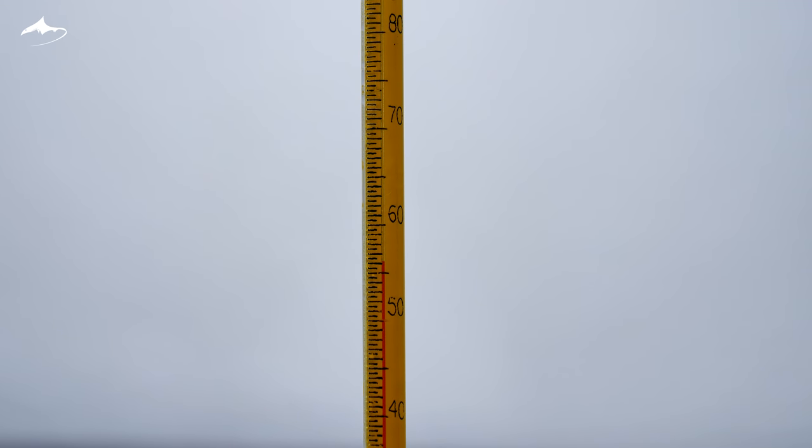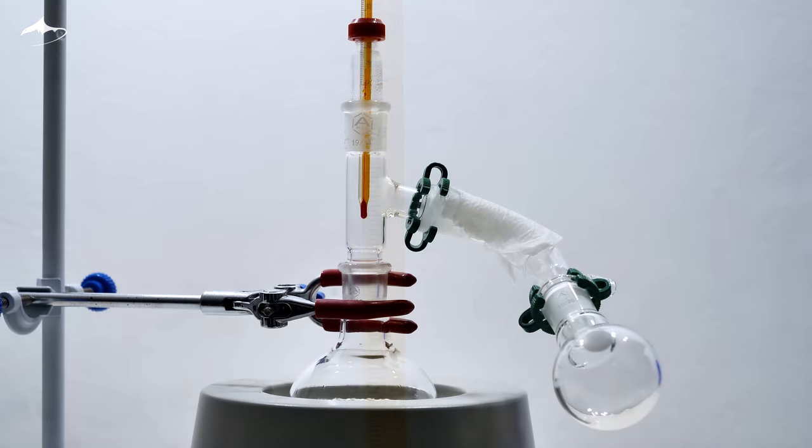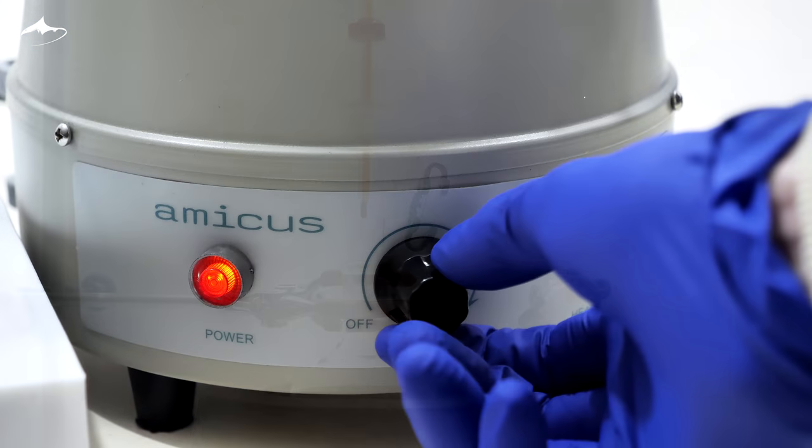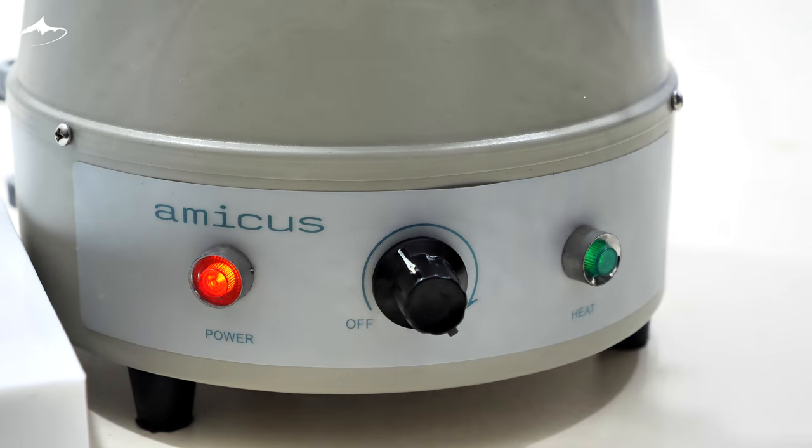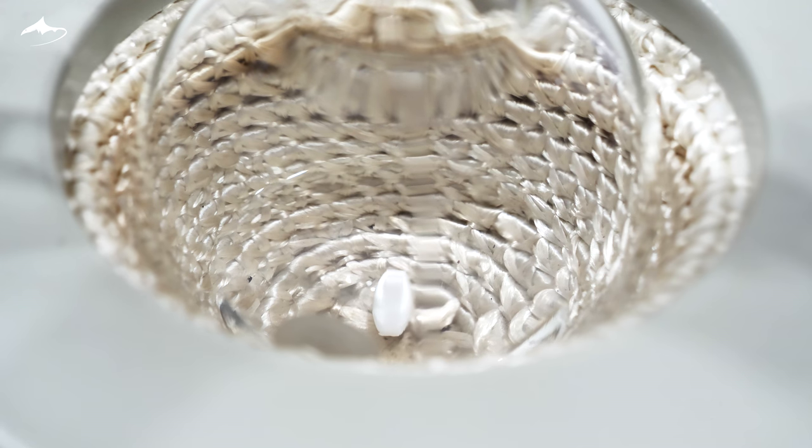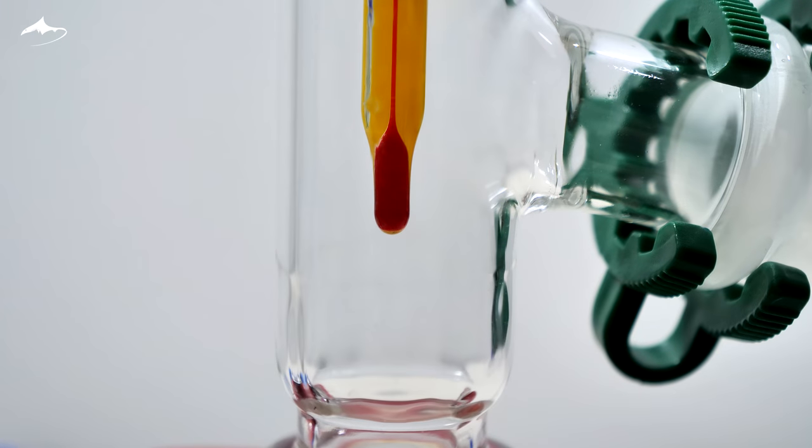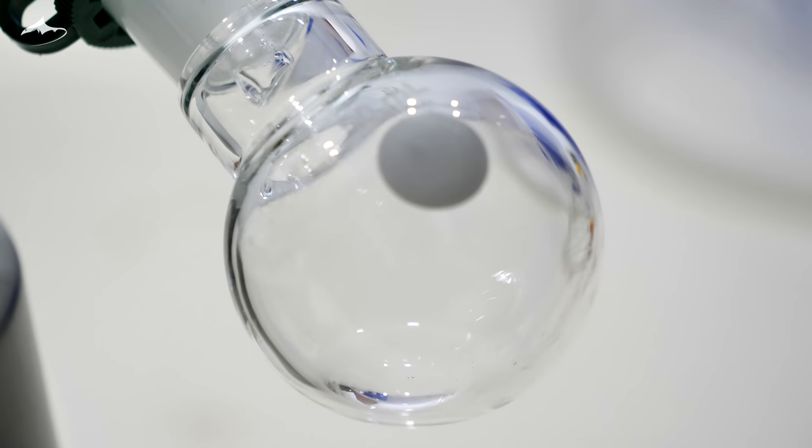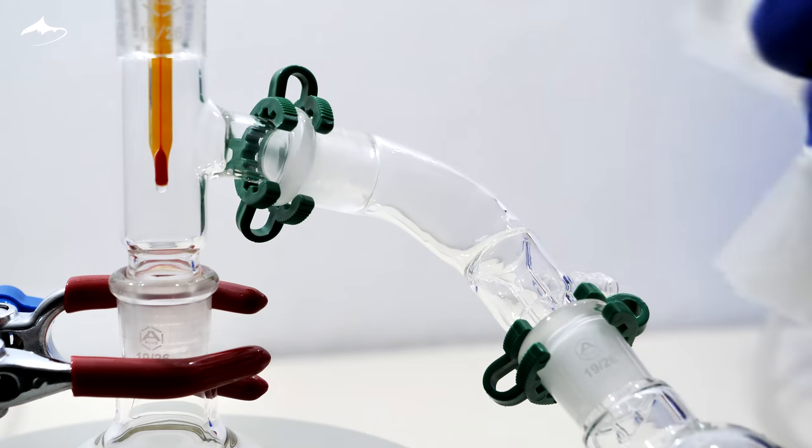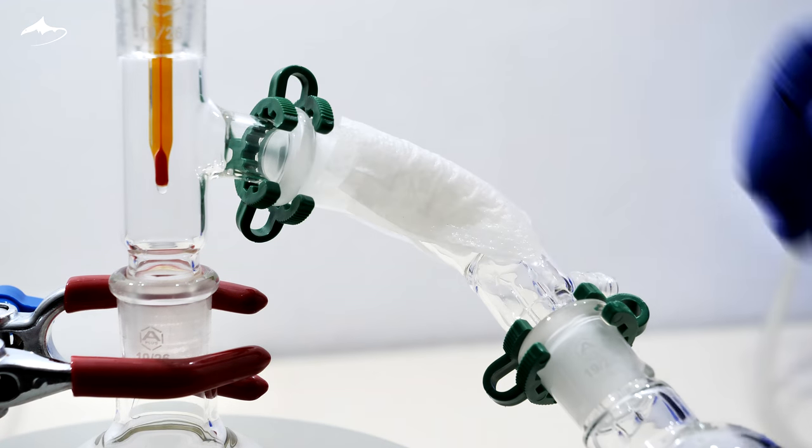When the temperature drops from the boiling point of ethyl acetate, the apparatus is changed to distill it using an air condenser. The heat is turned on and special attention must be paid to the thermometer to monitor the process. Some leftover ethyl acetate comes first. Also, wet paper must be changed with a fresh one several times, as it gets hot very quickly.